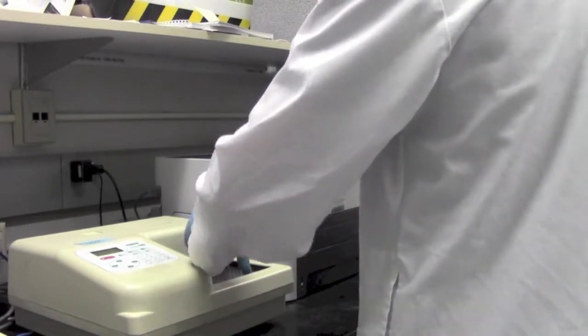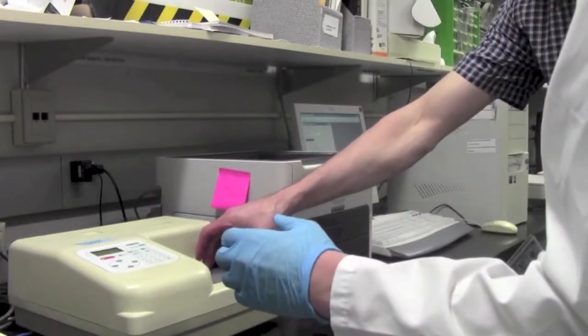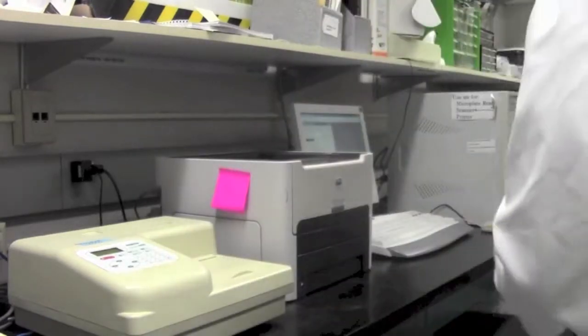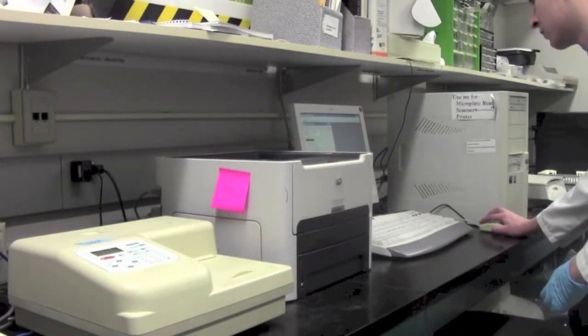Note that this particular optical density system does not have a blanking mechanism. Instead, you must blank your samples after the measurement is taken using a standard where you set up.